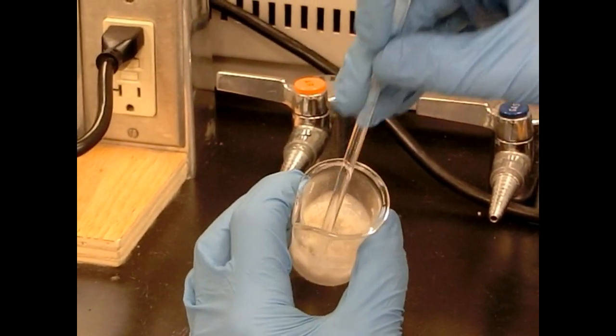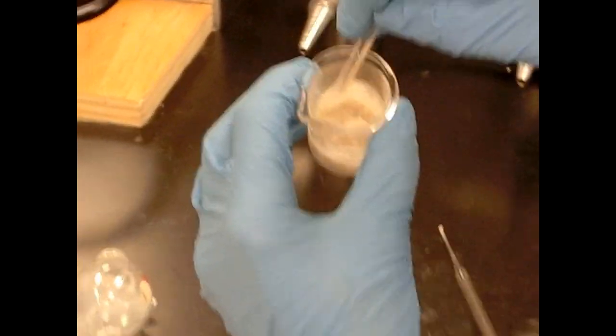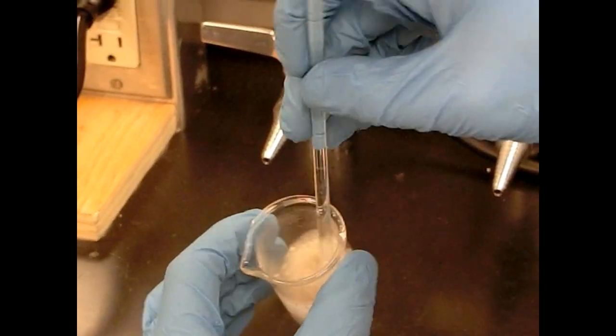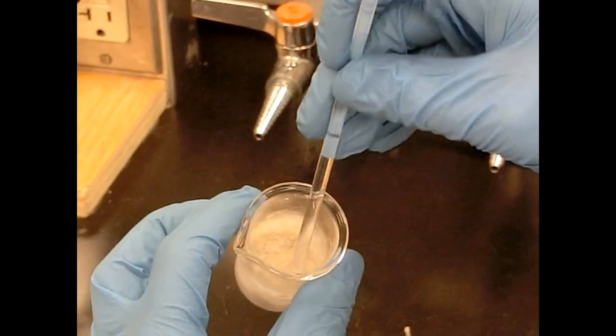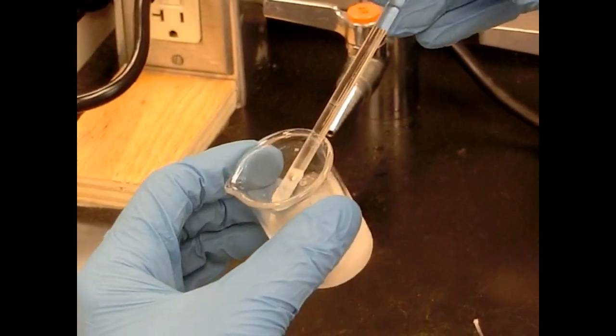And there we go. And we're still using a little bit of dry ice, but that looks like a really good yield. A little bit of ether's left over, but that looks scrumptious. And then the next step to this is that we can add HCl and now protonate it to form the benzoic acid. And this was the hard part of the job. We've got our molecule.